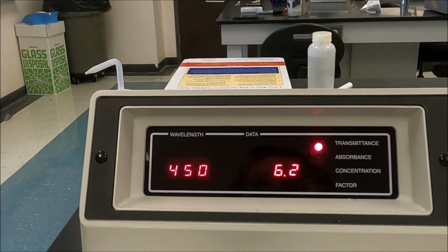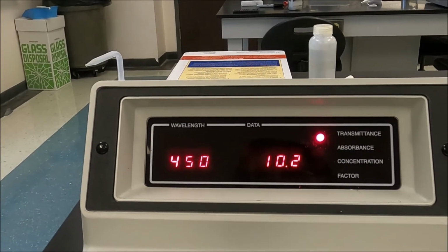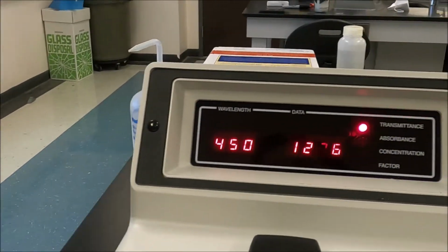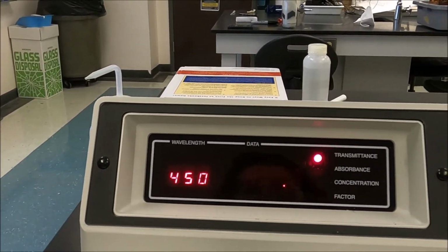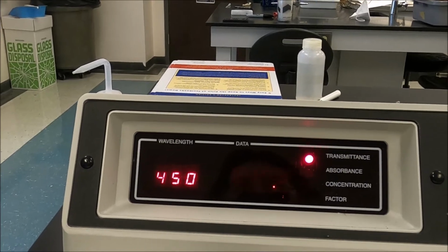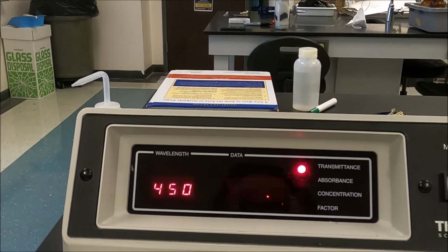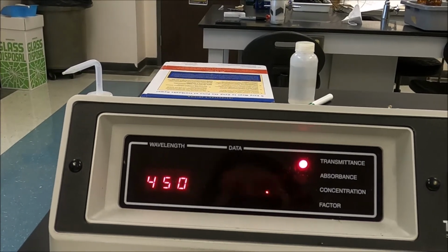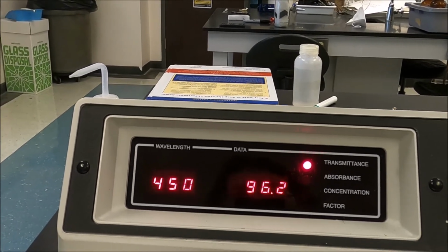Boy, somebody got this cranked way down. Oh, hold on. A knob was flipped. So let's get this down to 100. I was like, boy, that was way off. Okay.